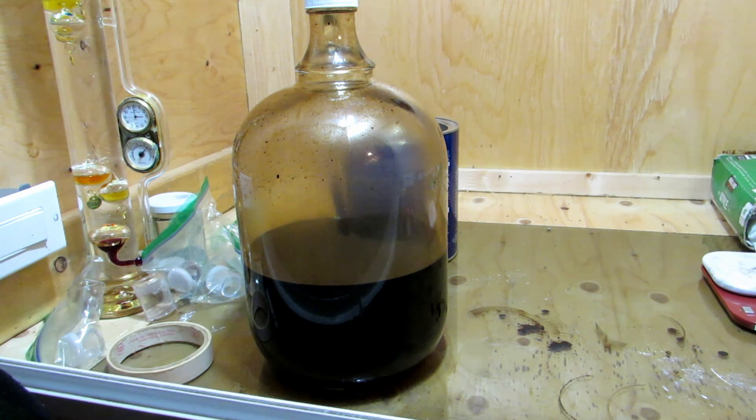We'll let this settle out probably for another 20 minutes or so. After that, we're going to be transferring this into a separatory funnel to separate off the lower organic layer, which contains our caffeine. Then we'll move on to purifying that and hopefully get some pure caffeine in the end.